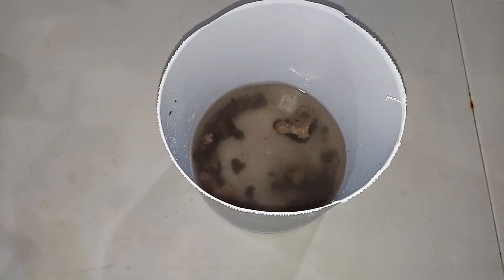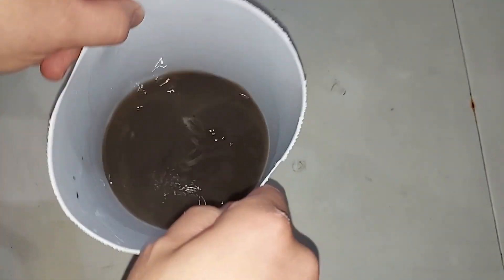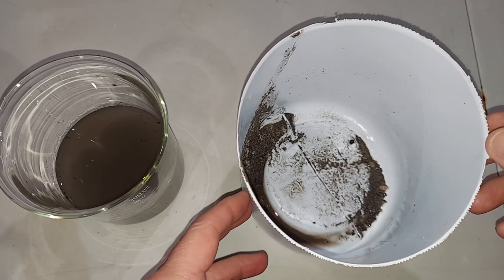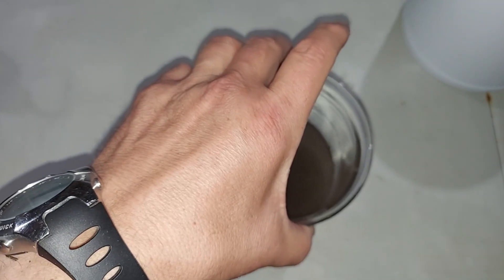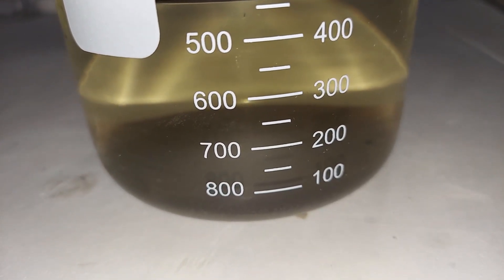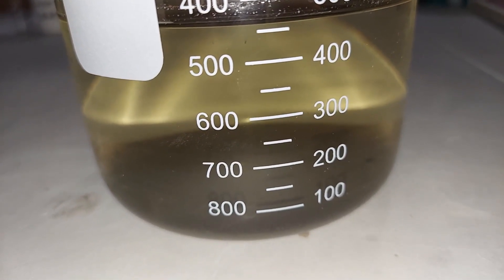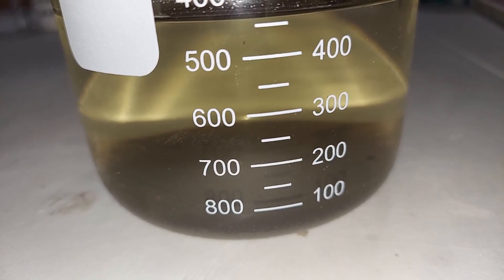It's truly hard to believe anything useful is going to come out of this. We want just the liquid, because that's where the potassium carbonate is dissolved. I decanted into a one-liter beaker as best I could and let it settle. It majorly settled down overnight, so I'm going to decant the top liquid — there are still little bits and pieces, so I'll still filter it. That liquid contains the potassium carbonate and that's what we want to boil down in the end.